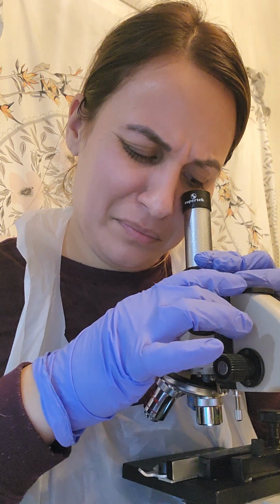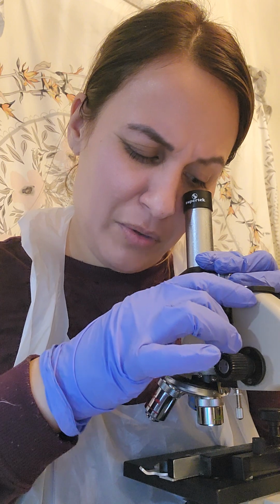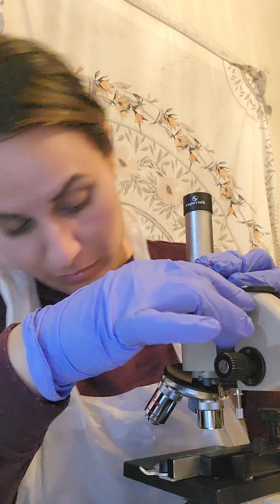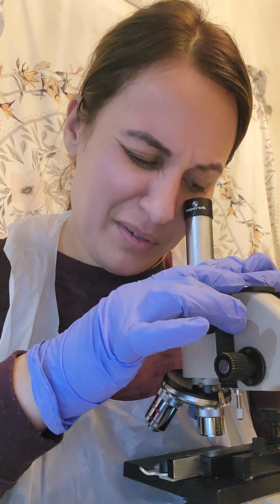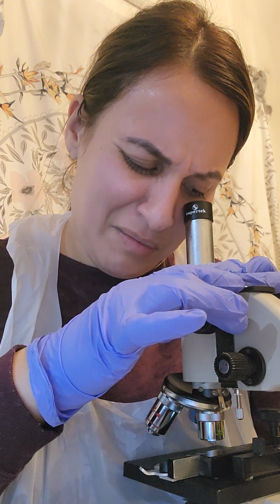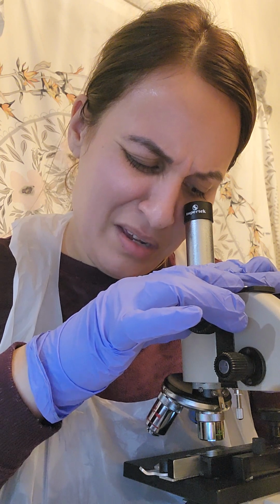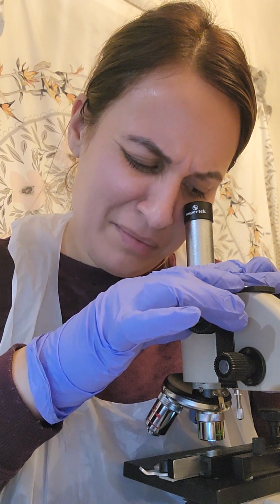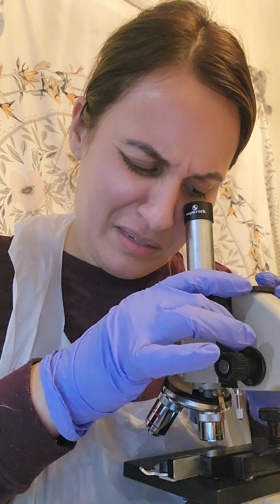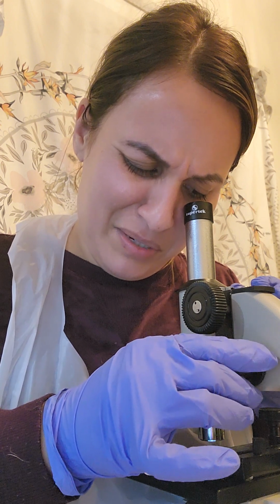Alrighty. And as you had suggested, Professor, going slower does help. How far am I though? Okay. So immediately I see a little red splotches. Let me fine tune this a little bit to see if I can.